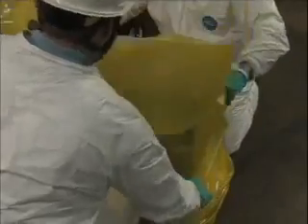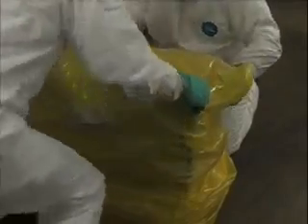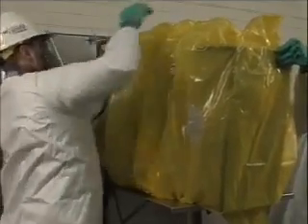Carefully pull the shock cord of the change-out bag to the bottom of the filter. Pull the remainder of the bag down until the filter is at the back of the change-out bag. Turn the filter over and pull the bag up. Place the new filter in the new change-out bag on a table or change-out shelf. Install the new change-out bag with filter around the bagging ring over the top of the stub bag as before.